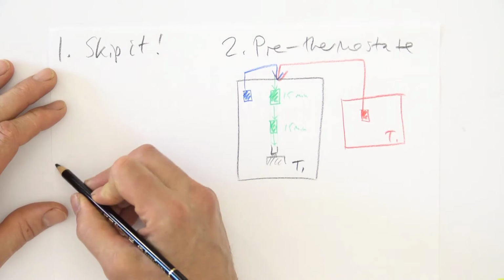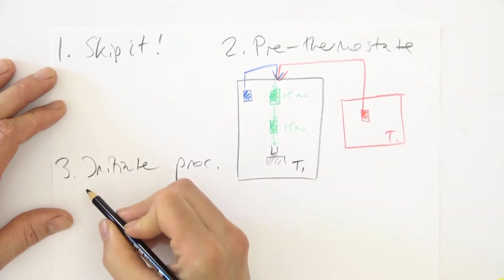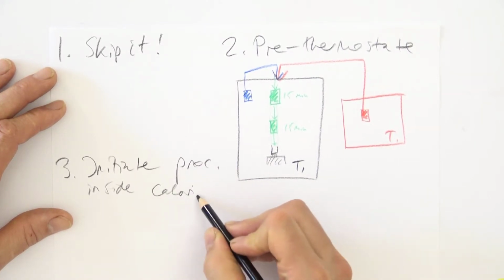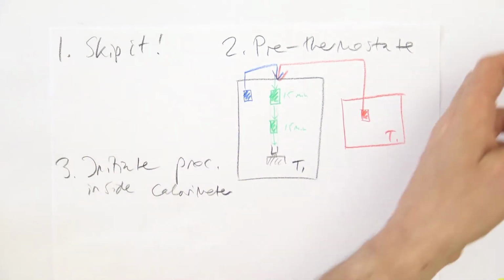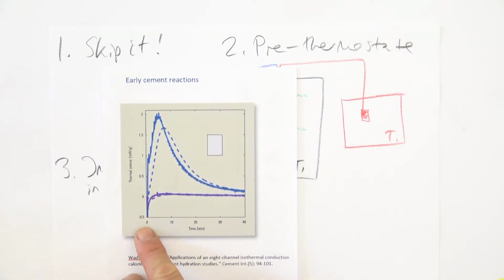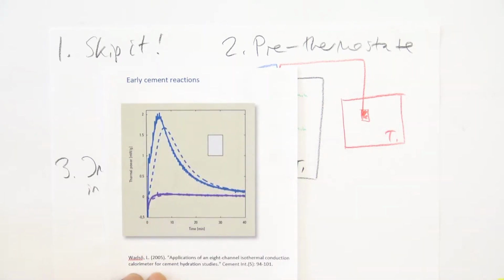And then we have number 3, and that is to initiate your process inside the calorimeter or inside the vial. And I will show one example where that has been done. This is a cement hydration measurement, and if you look at the time scale here, it says 0, 10, 20 minutes, and this blue peak, for example, peaks after 5 minutes, and it's not possible to do a measurement like this by mixing cement and water on the bench, charging into the vial, putting the vial into the calorimeter. No, because then you get 30 or even more minutes of initial disturbance with no signal that you can evaluate.